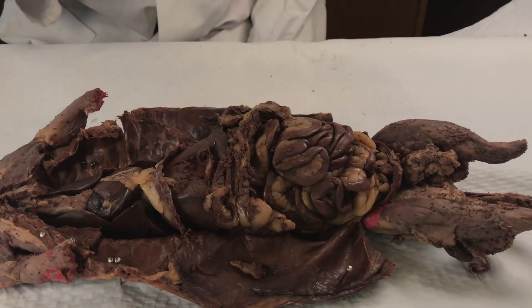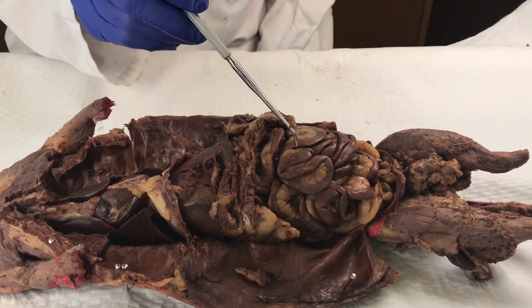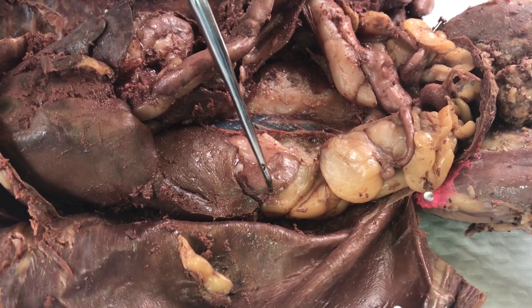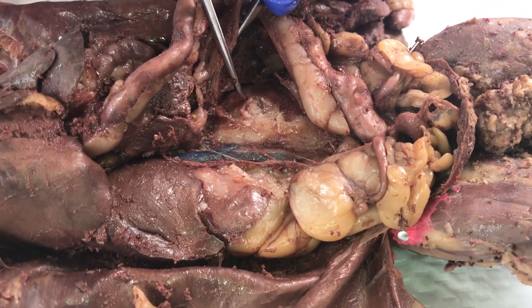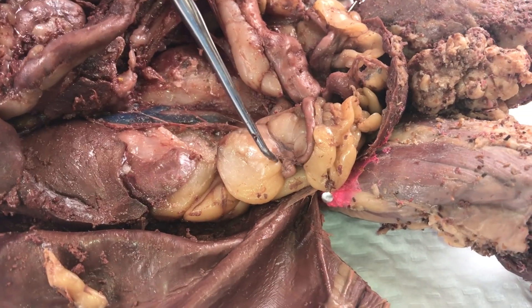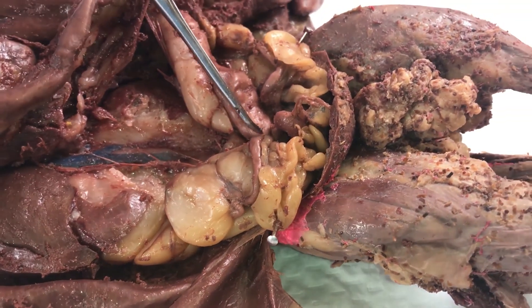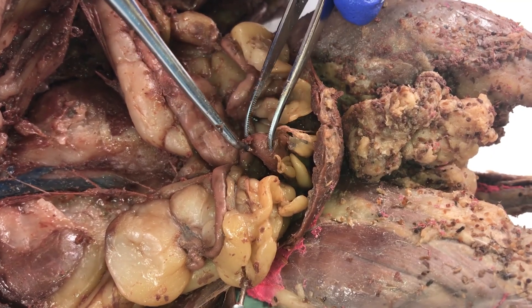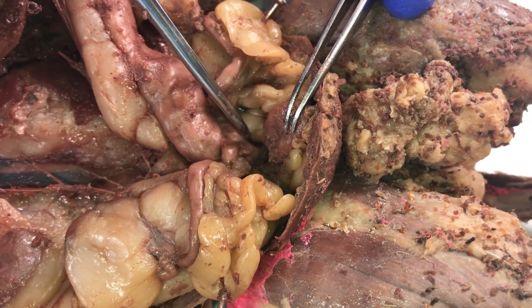Now to see the features beneath, we need to move those small intestines out of the way. Once those intestines have been moved, you can more clearly see features of the urogenital system. Here we have one kidney and another kidney, both embedded in the body wall. Our specimen here is a female. Here you can see the ovary and the oviduct. There is another oviduct connected to another ovary on the other side of this animal. Once you move the urinary bladder out of the way, you can see the uterine horns and the uterus of the specimen.